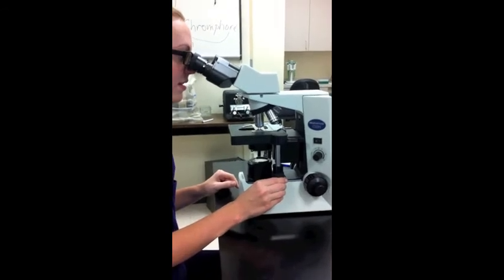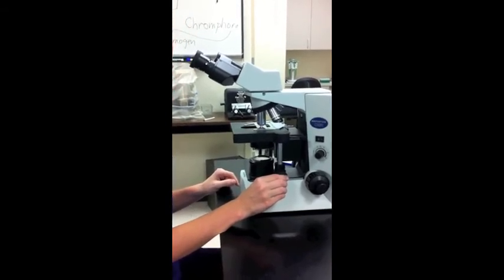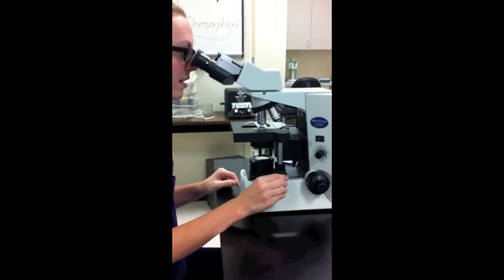Thirteen, once again, use the stage adjustment knobs to center your specimen in your field of view. This is a 40X slide in magnification.